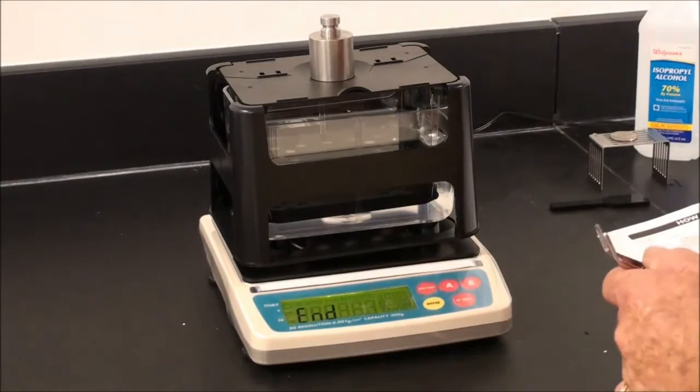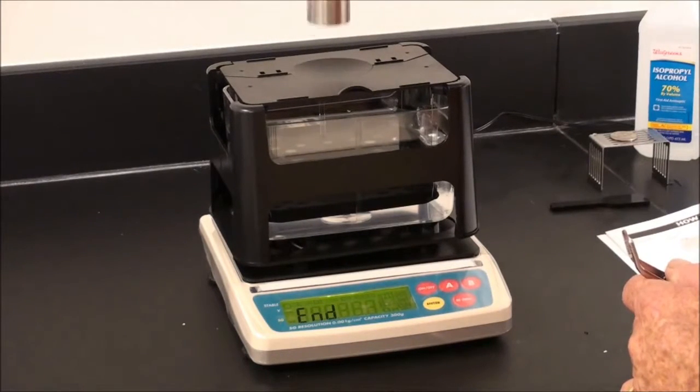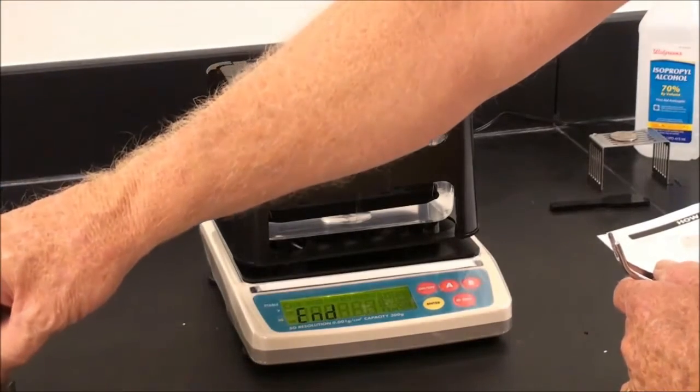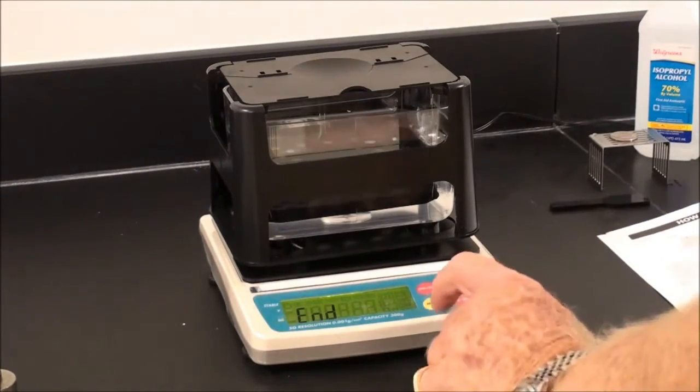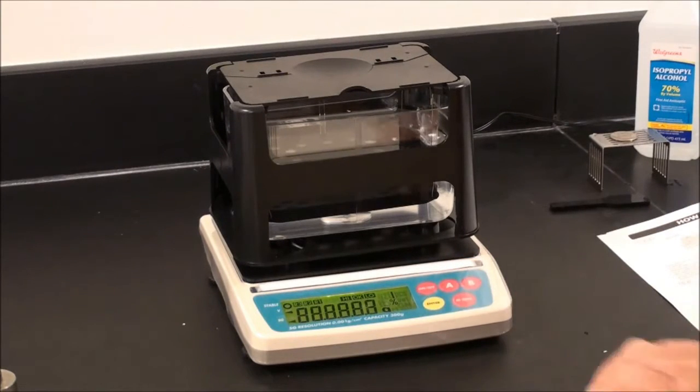Calibration is over. Remove the 200 gram weight gently and press the enter key. The system will reset, read zero, and you're ready for use.